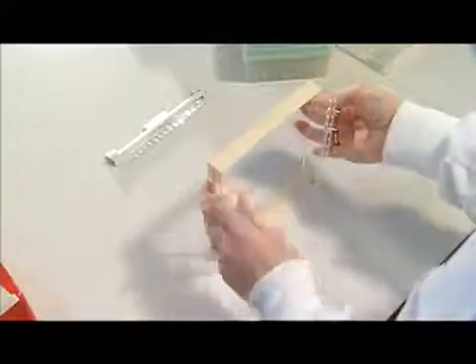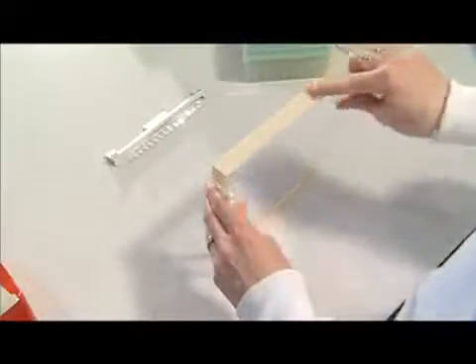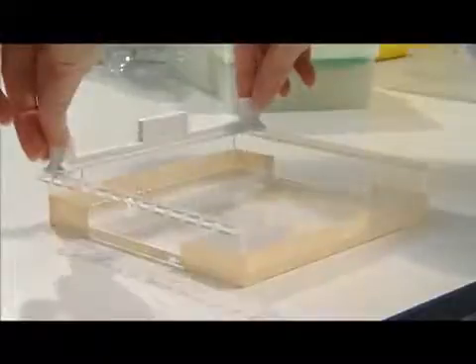Before pouring your gel, you need to make sure the gel tray is on a horizontal surface so the gel will be of uniform thickness. You also need to insert a comb into the gel tray. The comb will create cavities called wells, into which you'll be pipetting your nucleic acid samples.